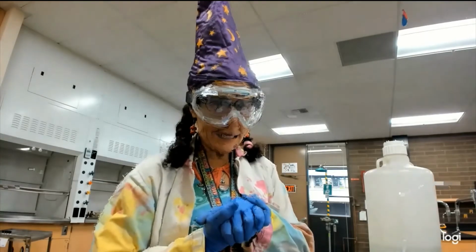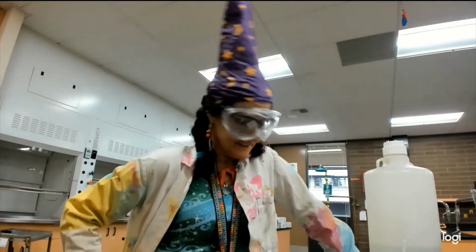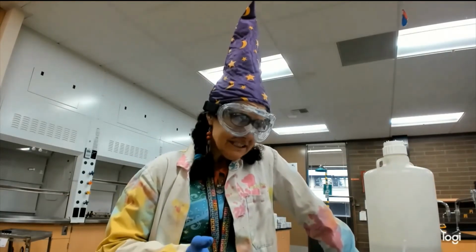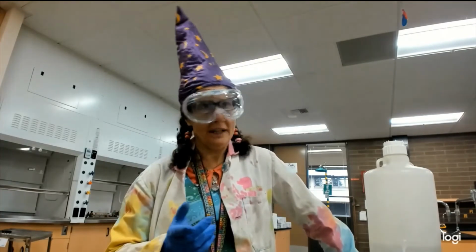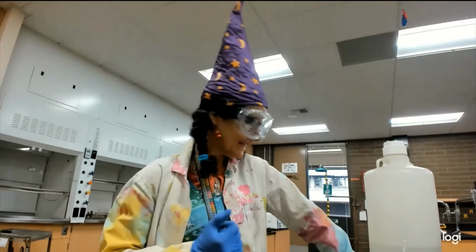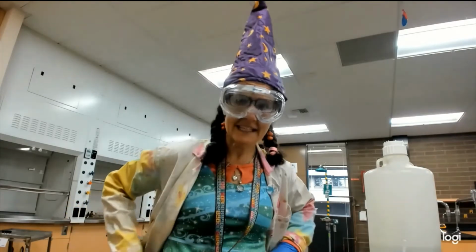Well, we're back. So, we're doing the silver mirror test, or Tollens test. It's for Dr. Tollens, who figured this out. And so, this is a test for aldehydes. It's an oxidation test, and as we've learned in class, or we will be this week, so by the time you watch it, we will have, alcohols can oxidize. Thiols, we're going to learn, oxidize, and aldehydes. So those are some things we're moving towards. So for right now, we're talking about aldehydes.